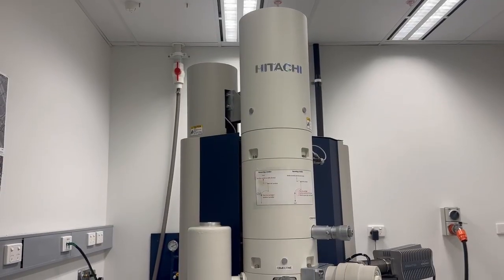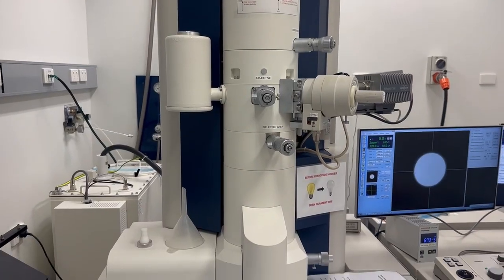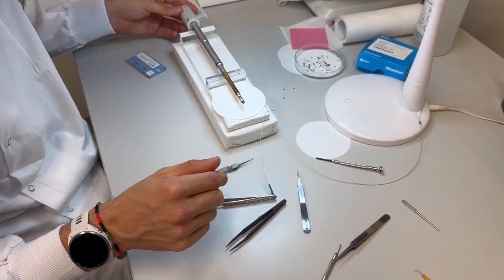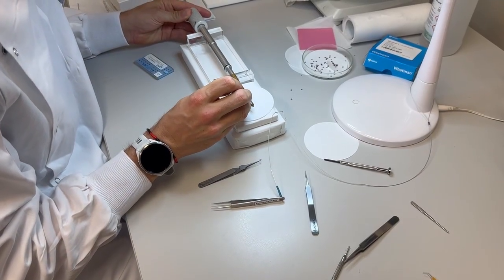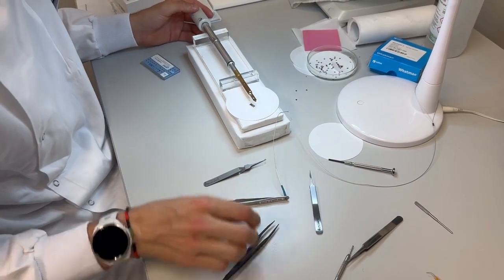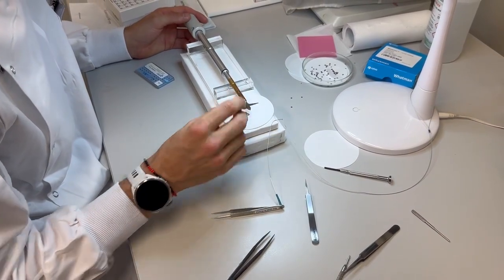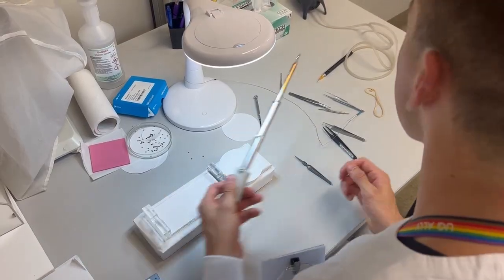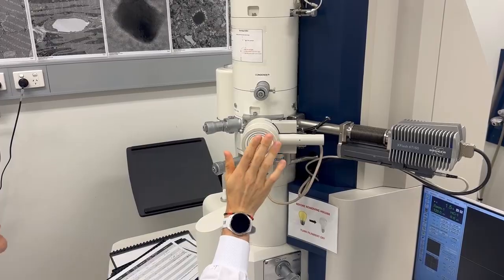Even though electrons are really small, this microscope is one of the biggest, fanciest ones I've seen. It requires lots of moving parts to make sure the electrons hit the samples just right. The little disc Connor is fiddling around with has our vaccine candidates stuck to it. Thousands and thousands of proteins can fit on this disc, which is roughly the size of a pea. Connor is setting up the microscope, which requires a lot of fiddling around to make sure our image is clear. After lots of button pushing, I'm seeing our vaccine candidate proteins for the first time.